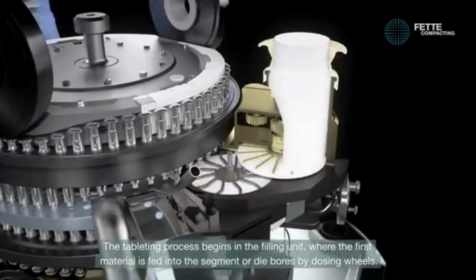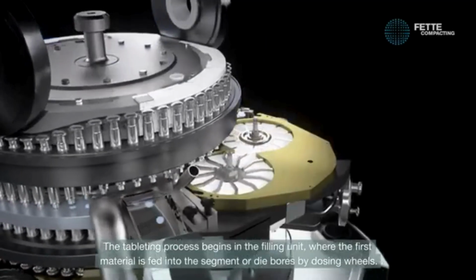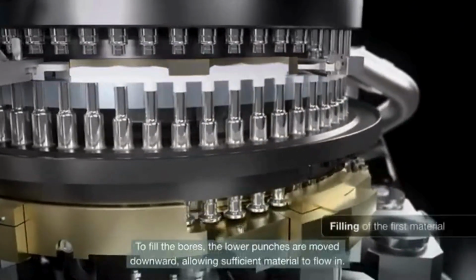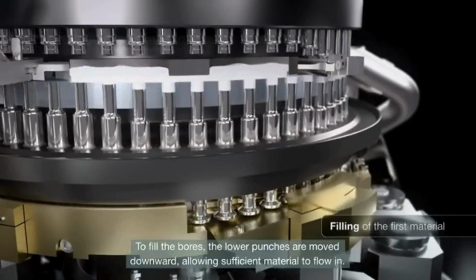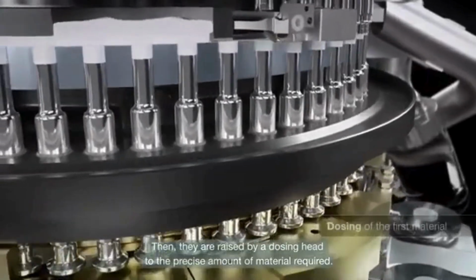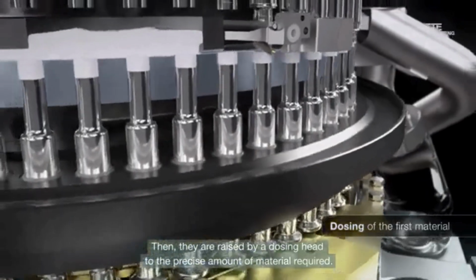The tableting process begins in the filling unit, where the first material is fed into the segment or die bores by dosing wheels. To fill the bores, the lower punches are moved downward, allowing sufficient material to flow in. Then they are raised by a dosing head to the precise amount of material required.